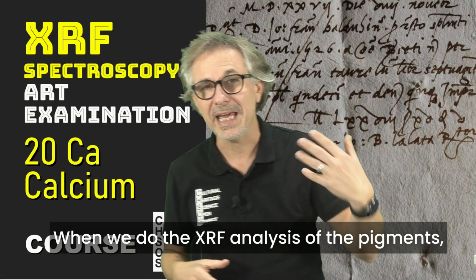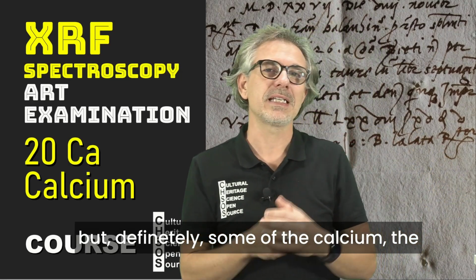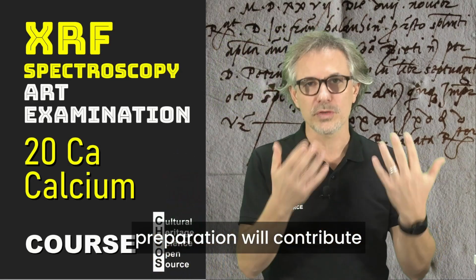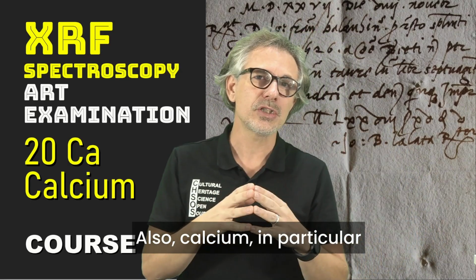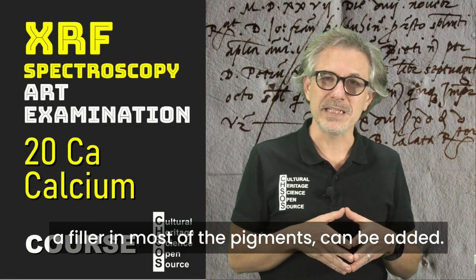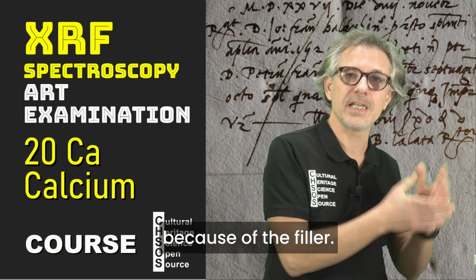When we do the XRF analysis of the pigments, they are on top of the ground preparation, but definitely some of the calcium signal from the ground preparation will contribute to the final analysis. Also, calcium, in particular calcium carbonate, can be added as a filler in most of the pigments. So we're going to find some calcium because of the filler.